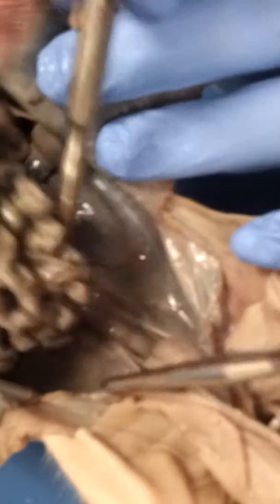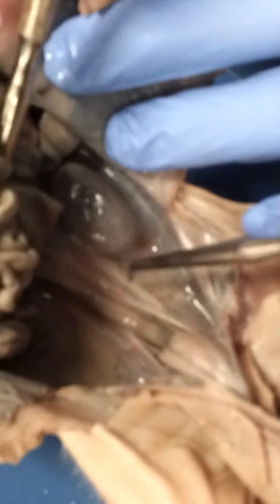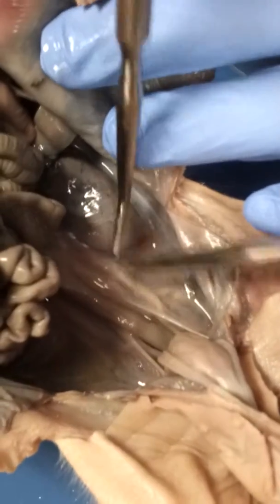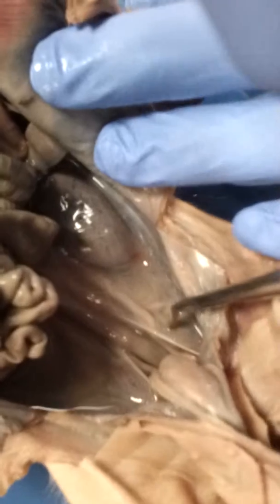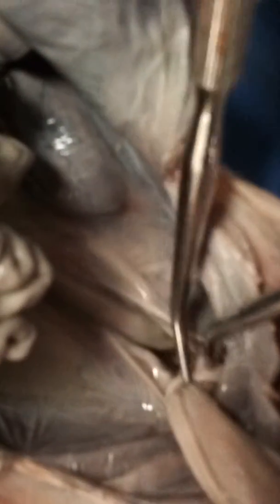And next we have the kidney. The kidneys are these huge bean-like structures. They have 2. One is right over here, and the other one is right over here. And that filters the water, which goes along the ureter, which is this one right here, and which goes into the bladder, which is right there, and goes out of the penis and into the bathroom.